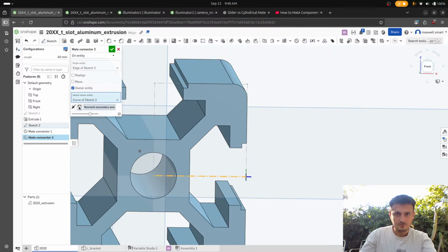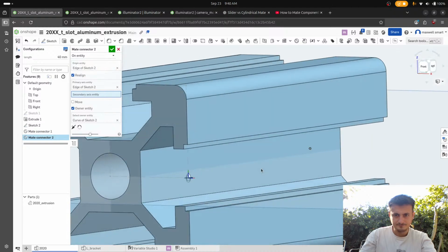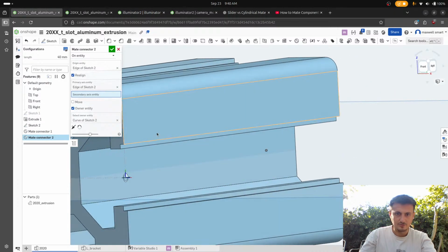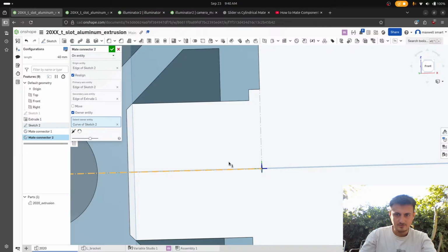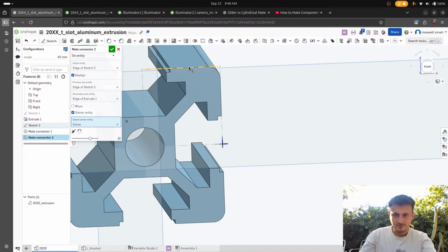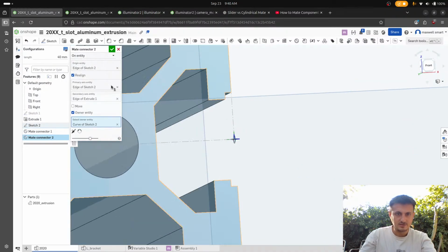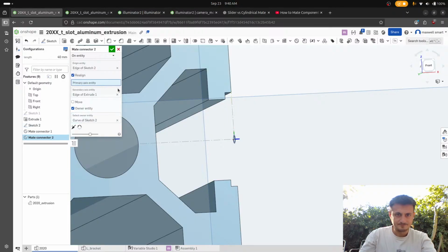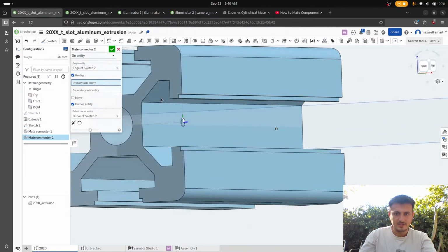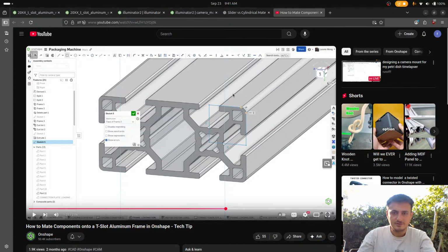But we want to realign. Oh no, we want to realign it to this way. No, wait. We want to realign it to this way? No, we want it so that the Z is... Wait, hold on. The primary axis... What does this mean? How did he do it?